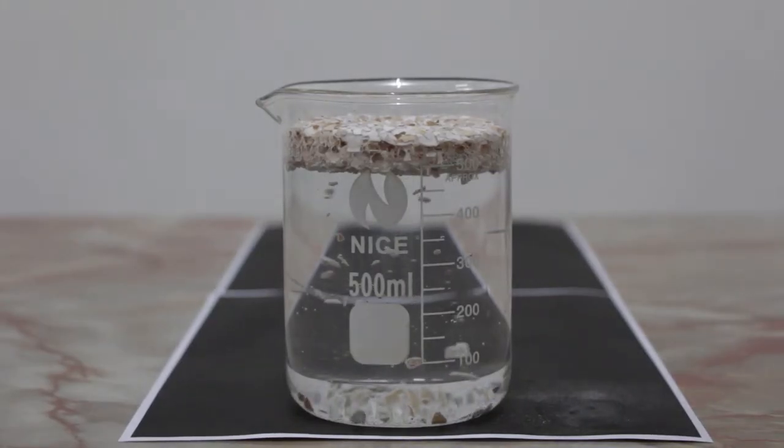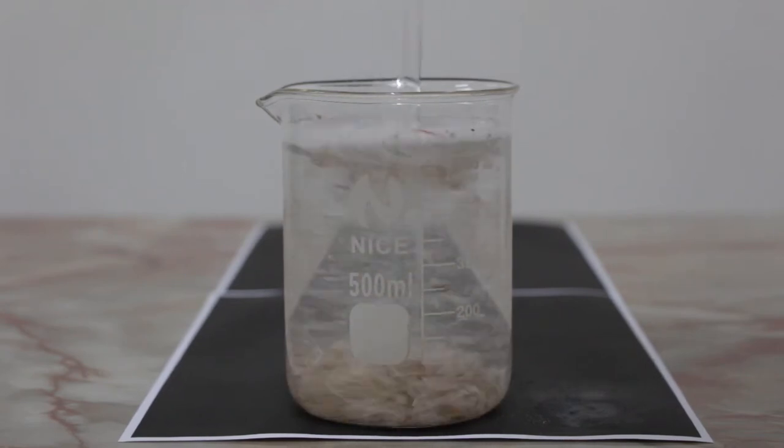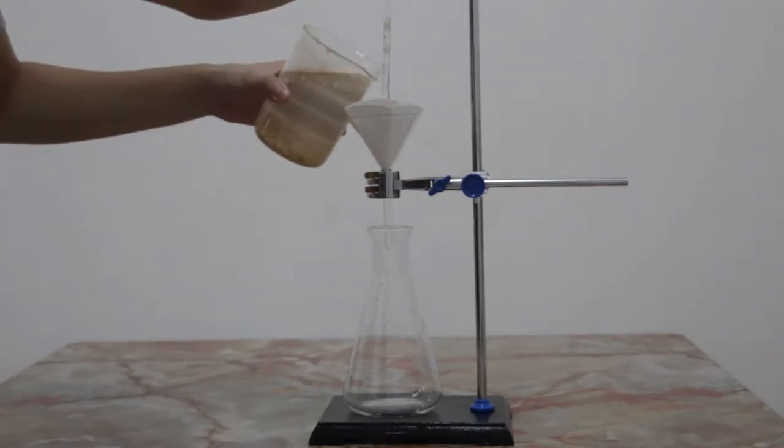For about 30 minutes, the solution is gently stirred with a glass rod and then allowed to sit for 2 days. After 2 days, the solution is filtered using gravity filtration method.